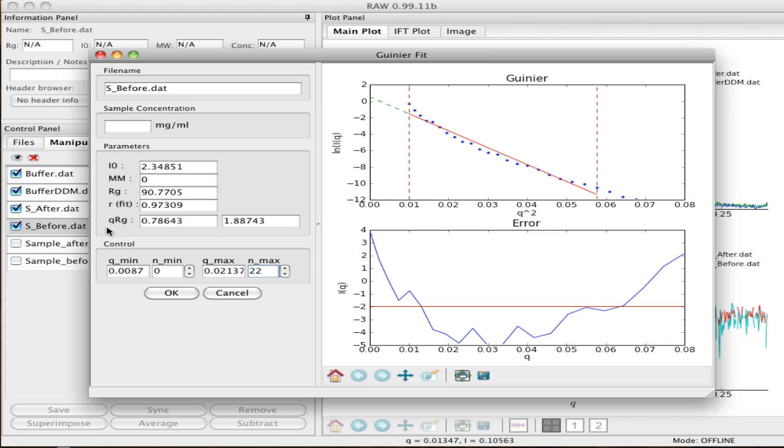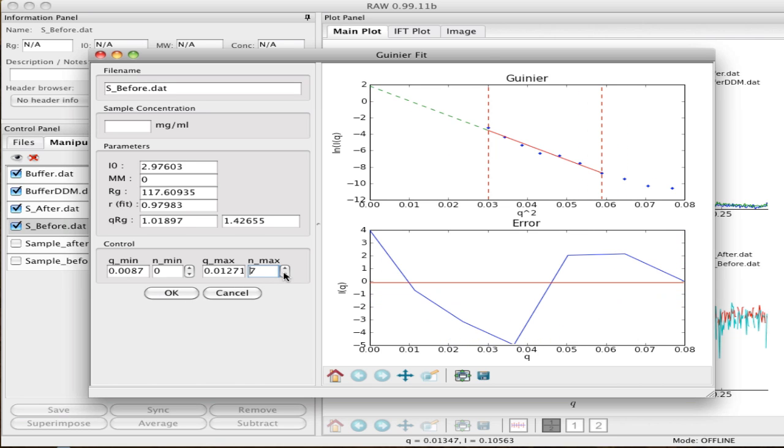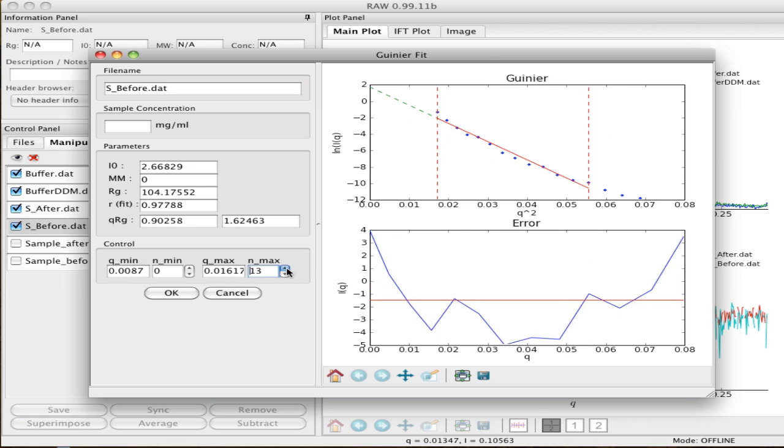See, we're at a qRg of 1.88. We're nowhere near the 1.3 that we need to be, and we have this characteristic smile. You can just keep going in, and the situation just doesn't get any better until you run out of points. You can take it down to a few points, but that's too far down.